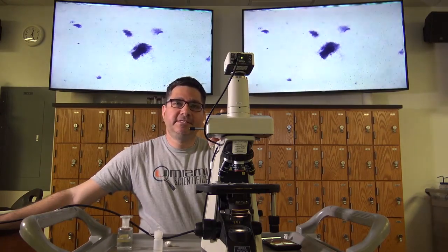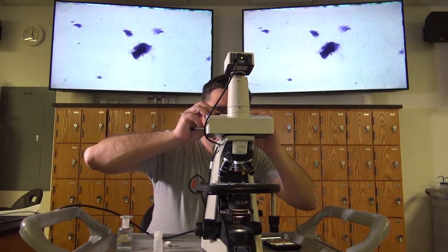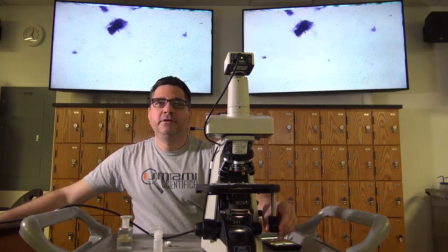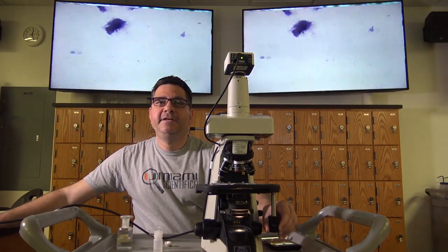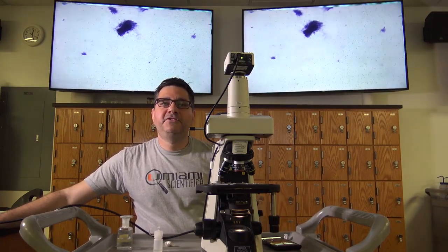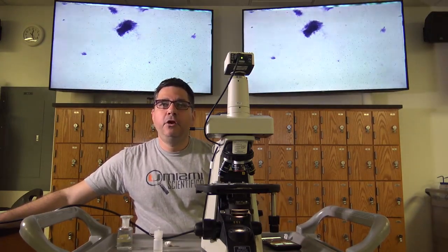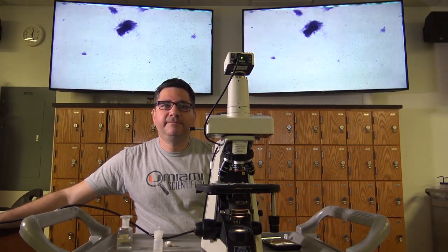Rotate your eyepieces while looking through them. If the specimen rotates, clean your eyepieces. Use the stage adjustment knobs to move the slide to the left or right. If your specimen does not move, refocus using the coarse adjustment knob. If you still feel that there's a chance that you may be seeing debris, wipe the light source with a lens wipe. If your specimen disappears after doing this, refocus.